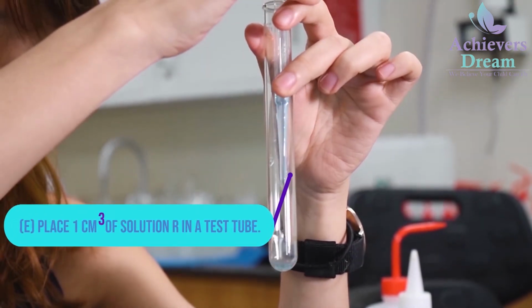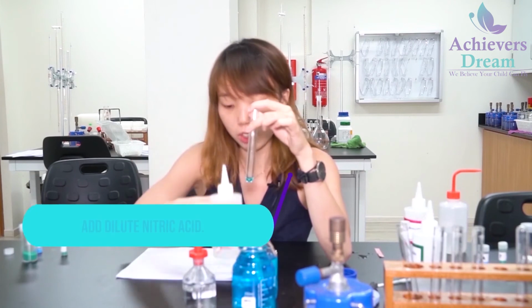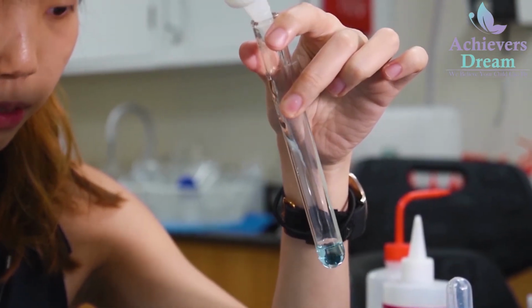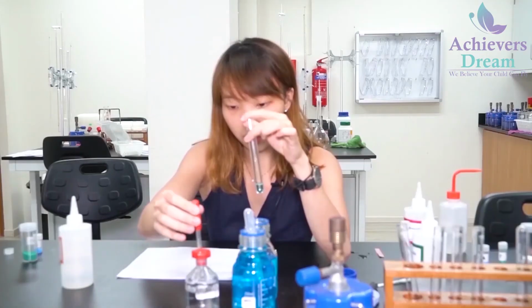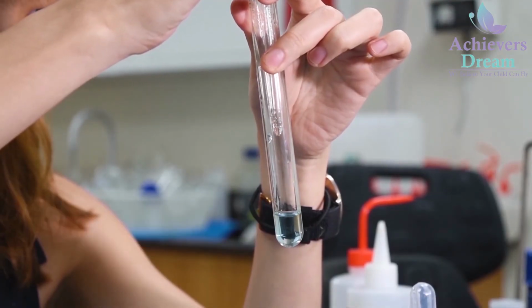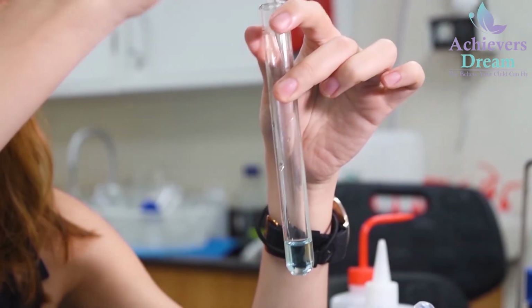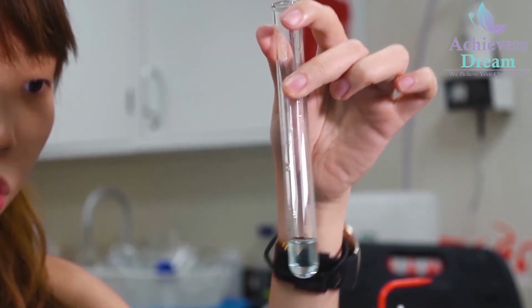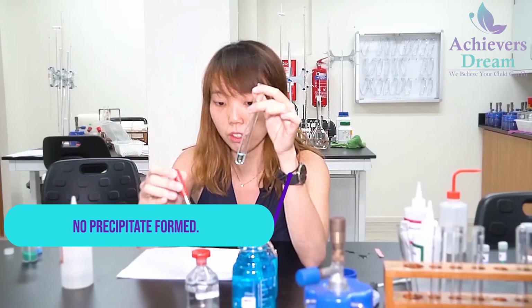For part E, I'm going to place 1 cm cube of solution R into a test tube, and add 1 cm cube of dilute nitric acid, and add barium nitrate. Upon addition of barium nitrate, there is no visible change, so you can see that there's no precipitate formed.